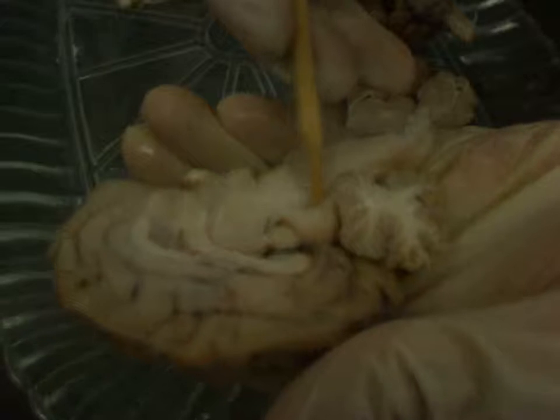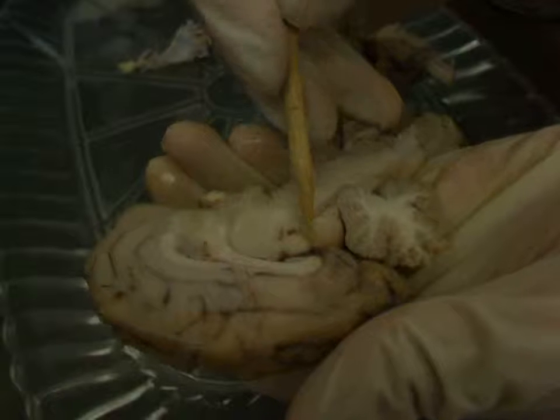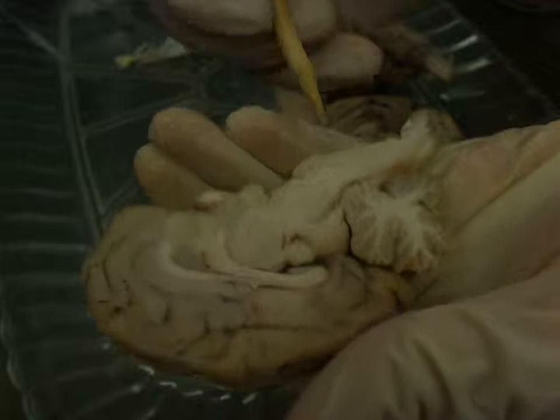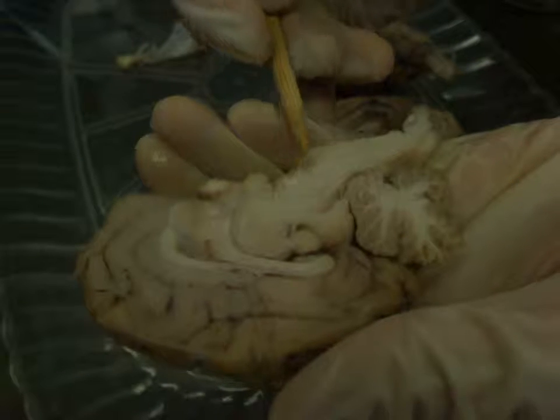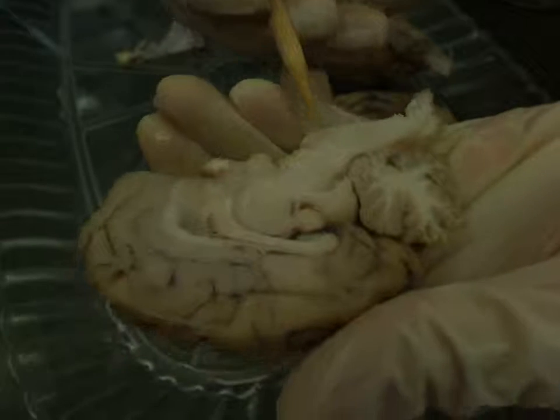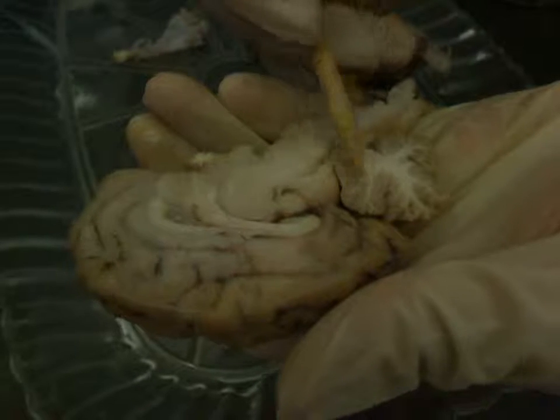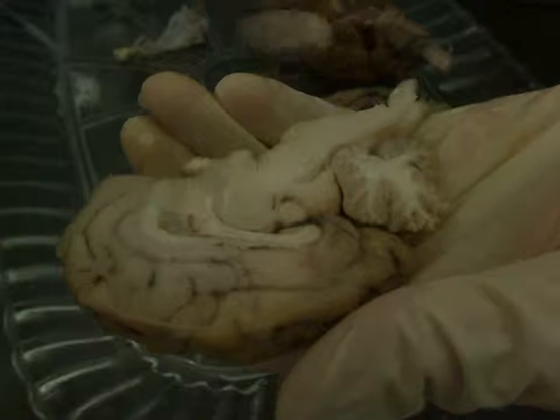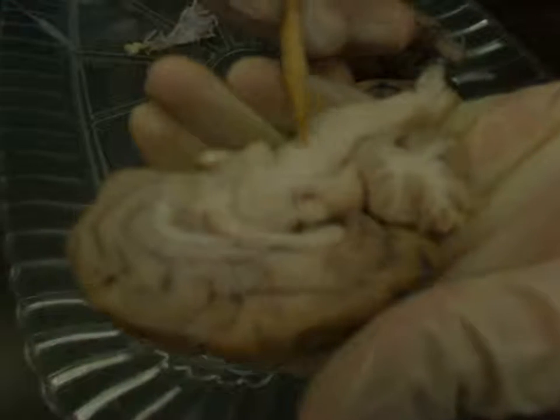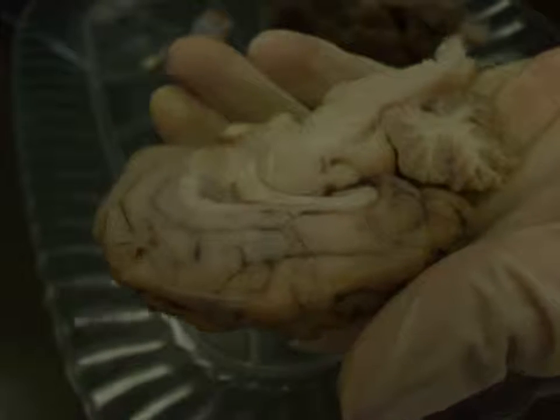The cerebral aqueduct, if we look at the top part of that, the dorsal part, we have the tectum, which is made up of the inferior colliculus and the superior colliculus. We also have the tegmentum down here. Okay. Other regions we can see the cerebral peduncles in profile here. We can also see the pons in profile here. Okay. In the cerebellum, we have the arbor vitae, the tree of life, coming out this way. Oh, if I said cerebellar peduncle, I meant cerebral peduncle up here. Okay. And that's it for metencephalon.